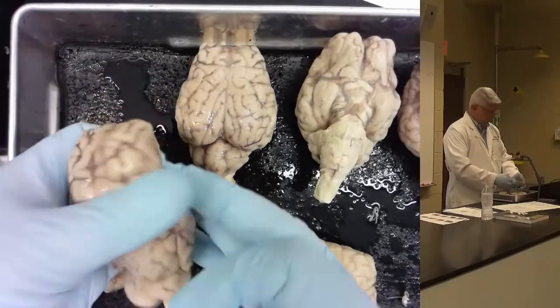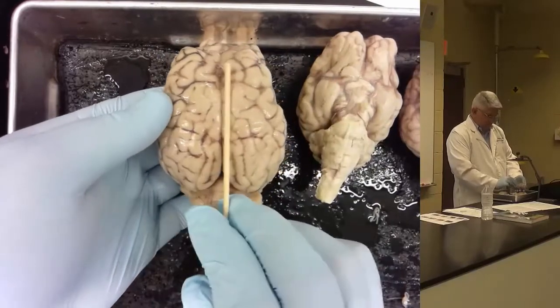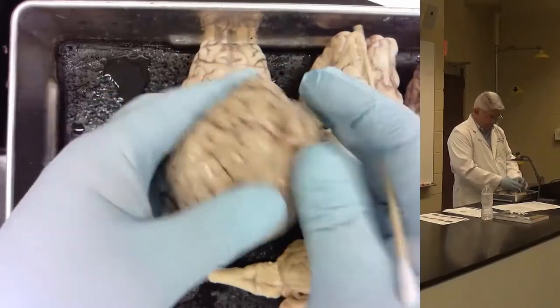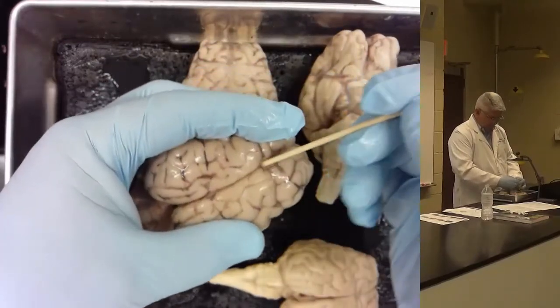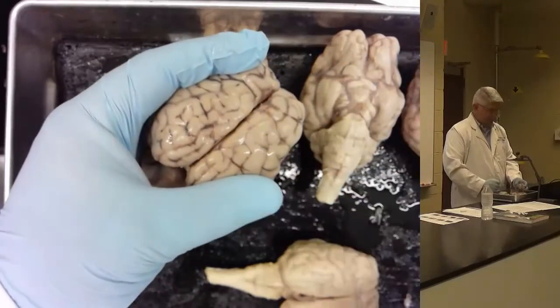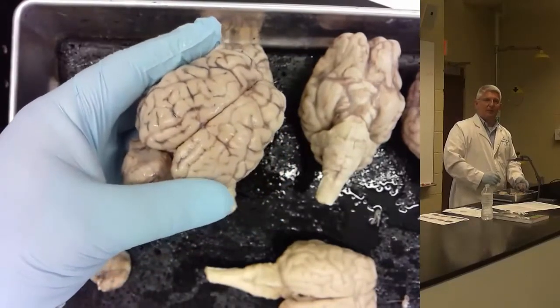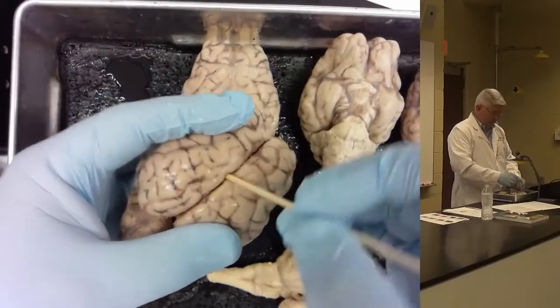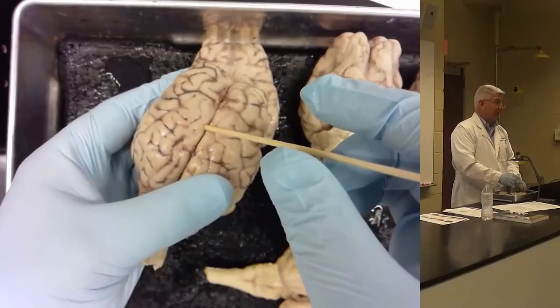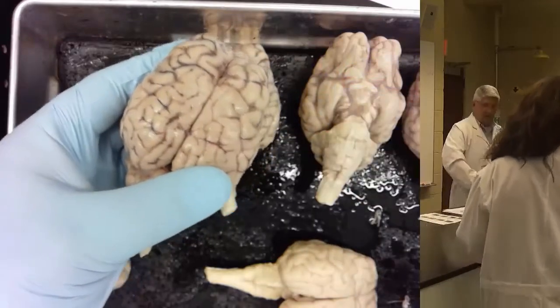Okay? All right, the first one is the longitudinal fissure. These are the cerebral hemispheres on the left and the right, and this big fissure in between them, you really don't want to take it apart because it's kind of connected, but this big fissure in between them is the longitudinal fissure. If I had a pen stuck there like that, and it said fissure sulcus on the key on your test, then that would be longitudinal fissure.